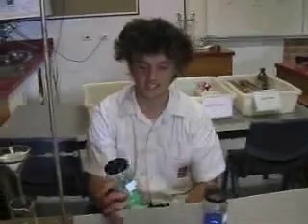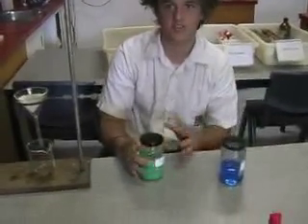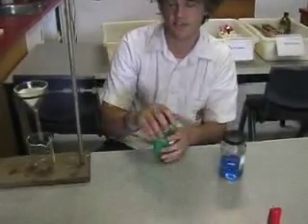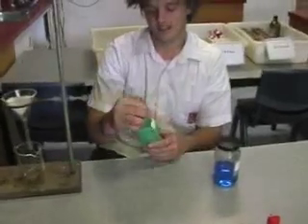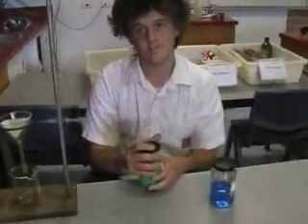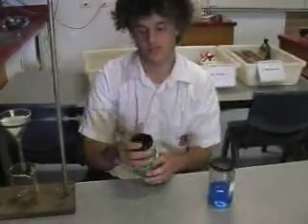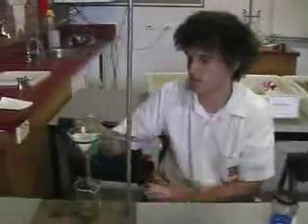This is liquid C — it's a suspension, so it's got particles floating around; it's not quite fully dissolved. What stuff's in it? This has got chalk dust in it — some water and chalk dust. Putting it through now.